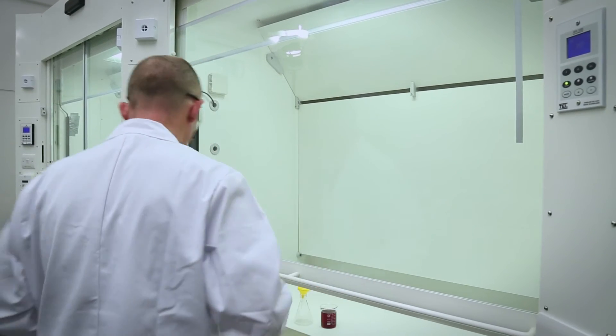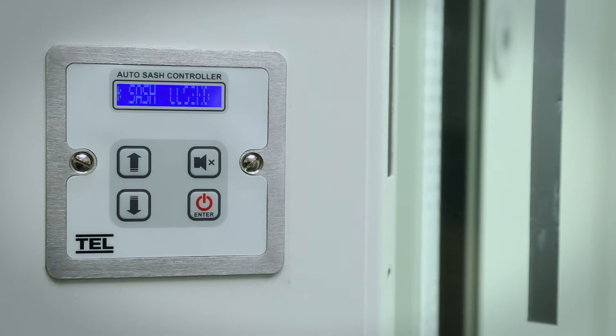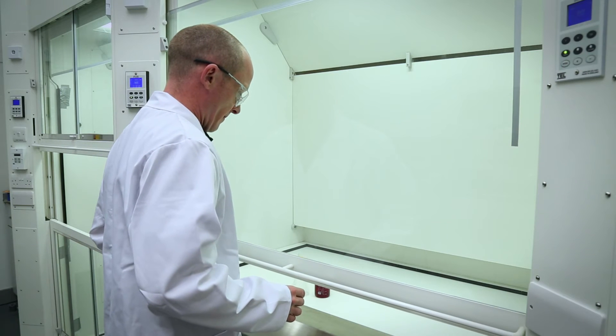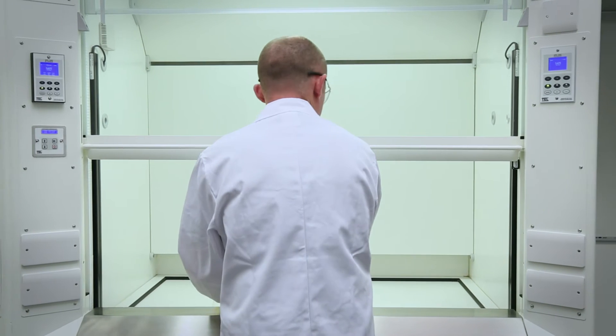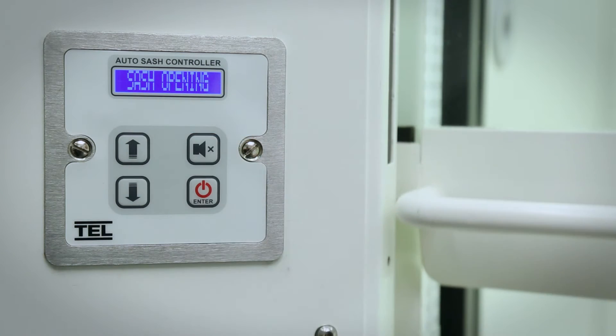If the user has specifically left the sash at a height for safety reasons, the auto open function will only open to that height when the user returns. During times when the operator is present, the sash can be operated manually via the optional Tiptronic touch sensitive feature or by using the keypad.